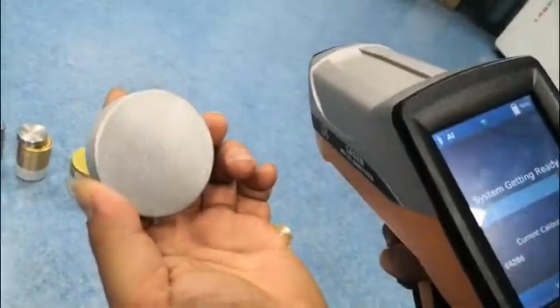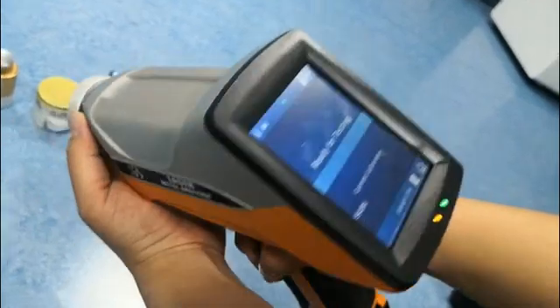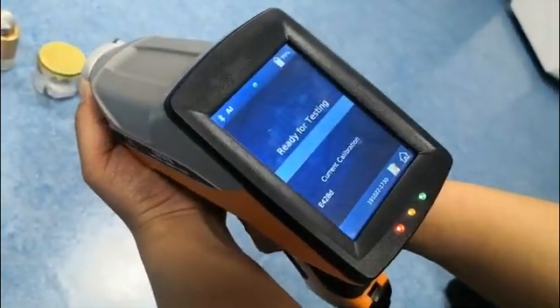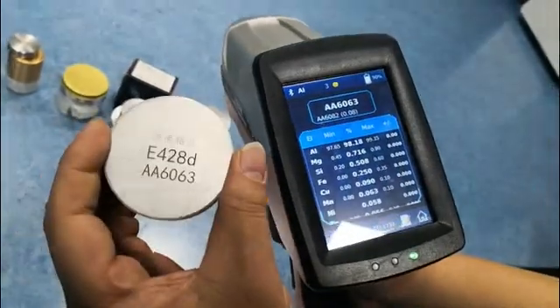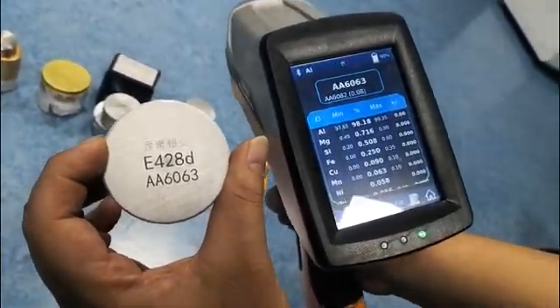This is the aluminum alloy standard sample — put it here. Okay, this is 3006 — 6063.